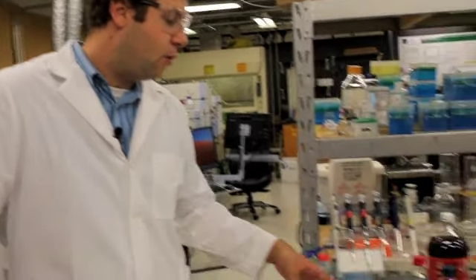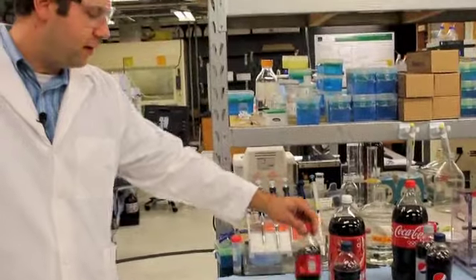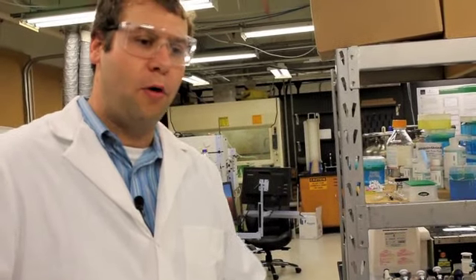The more information that we have to start with, the better chance that we're able to give you an answer that works for you. These are Coca-Colas or colas. We pretty much know what's in these because of what's on the ingredients list. A lot of the times if customers bring in samples and they bring in dirt, where'd the dirt come from, what are you guys looking for, what's the concentration of what you're looking for always helps. The more we know about the sample, the more we're able to pre-treat it to put it onto the instrument to get a more direct and better answer.